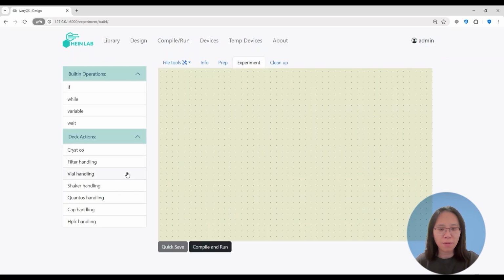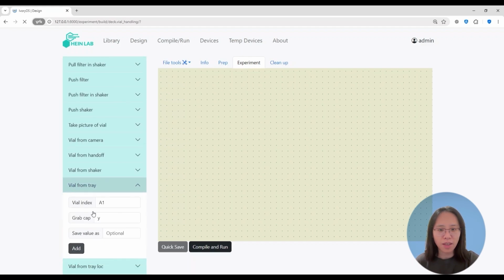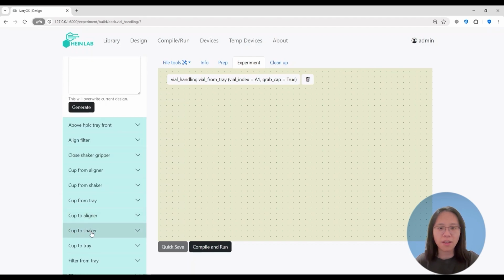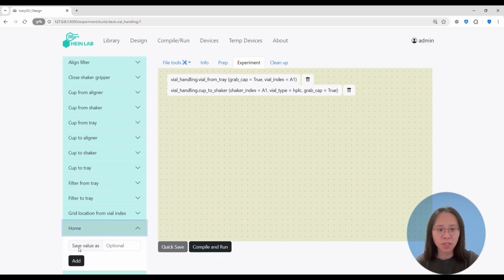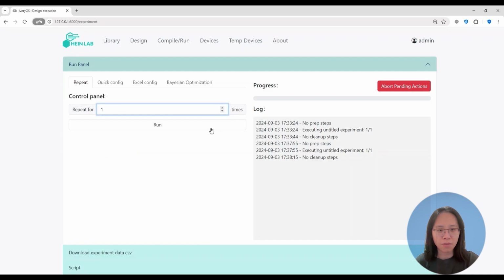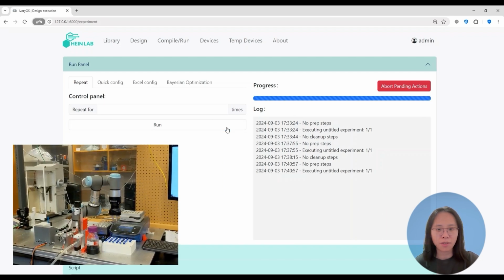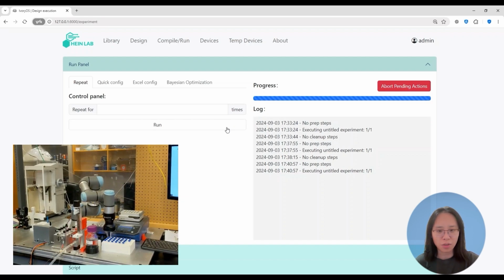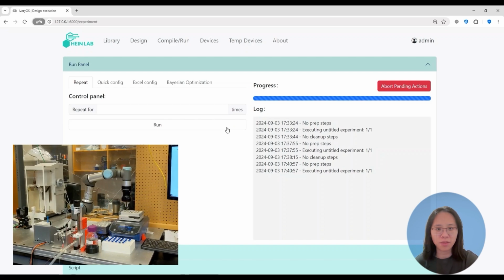So here I will start with transferring the vial from the vial tray and then move it to the same location at the thermal shaker. Then I will set the arm back to its home position. And now I have my workflow. I'm going to compile it. Since I can only repeat this workflow, I'll just run this one time. Now the robotic arm slowly approaches the vial and then takes it to the thermal shaker. Once it's done, it will go back to the home location where it started.